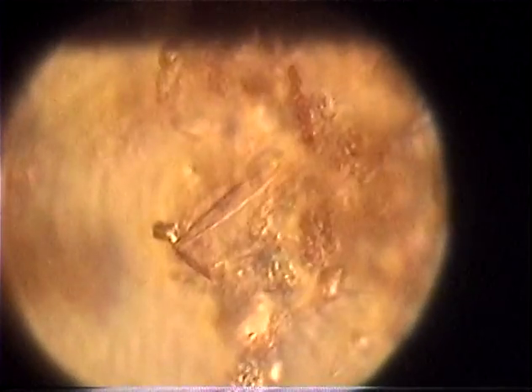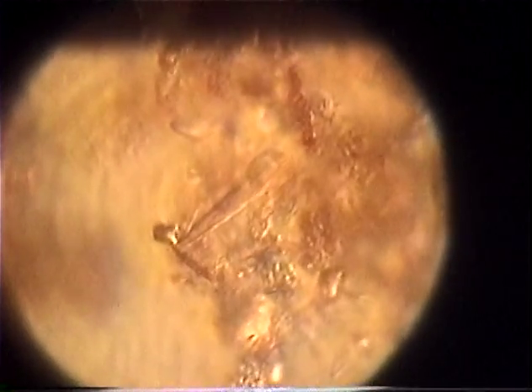See if you can get a shot at a Hydra. I'm looking for it. I would love to find a Hydra. So far we've found some diatoms. Some more pencils, guys? Let's look on others and work quickly. All right. Pull that one off. Put this over here. All right, this belongs to Denny.